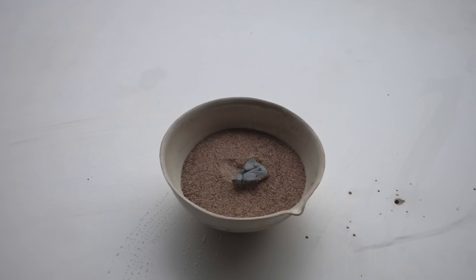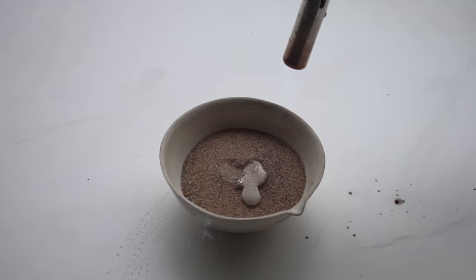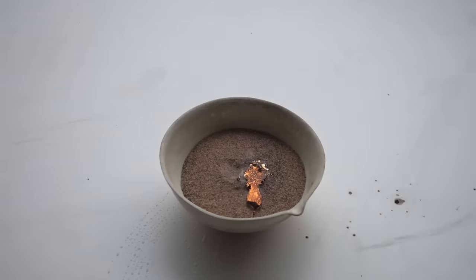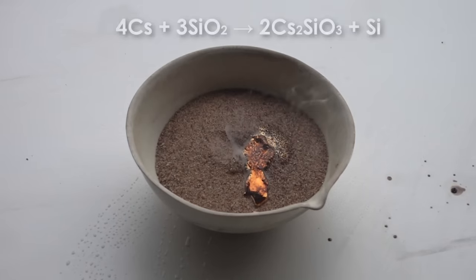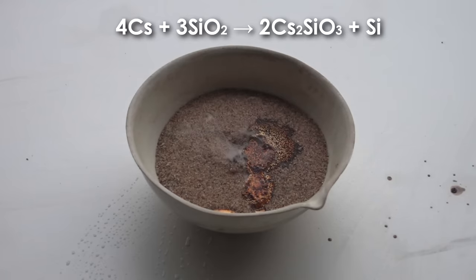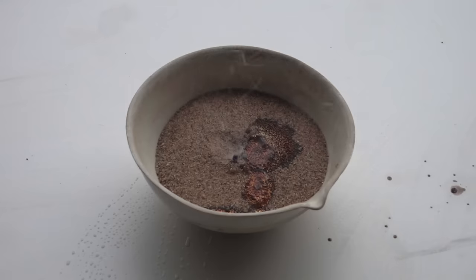Furthermore, by analogy with rubidium, I decided to conduct the reaction of cesium with sand, igniting cesium on sand. Similarly to rubidium, cesium reacts with the silica, which the sand consists of, very calmly and forms a beautiful shiny surface and also amorphous silicon.